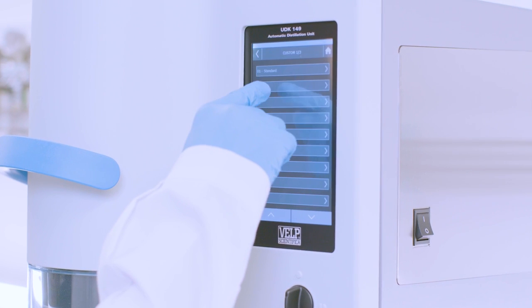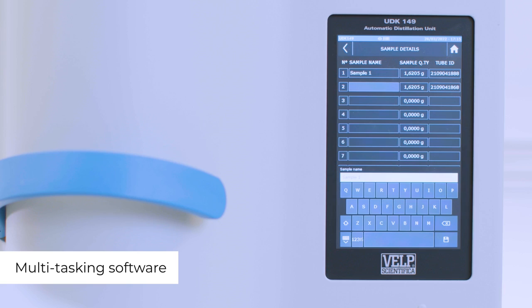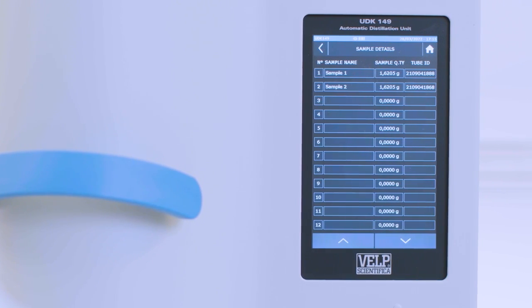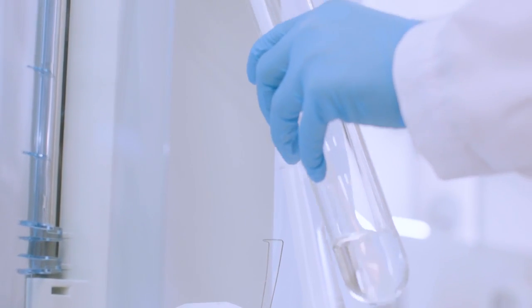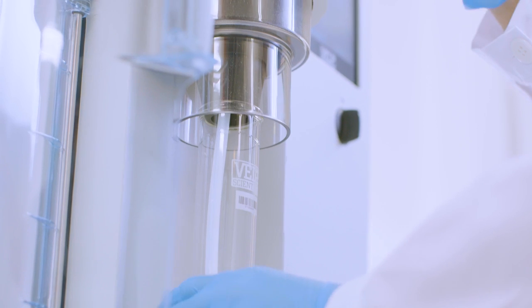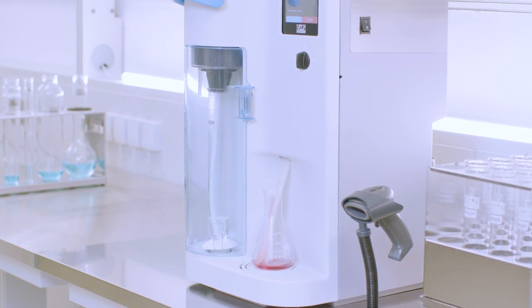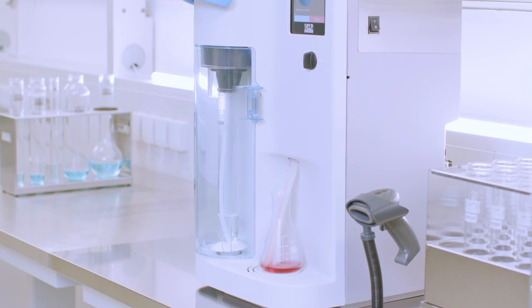Create a new method following the guided procedure. The multitasking software allows the user to set up a series of analyses, saving valuable time. The comfortable lever guides the operator to load the test tube into the correct position. The reagents are automatically dosed with extreme precision, providing a simple and safe operation for reliable analytical results.